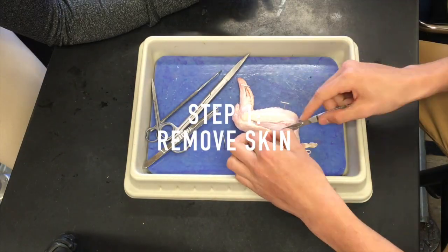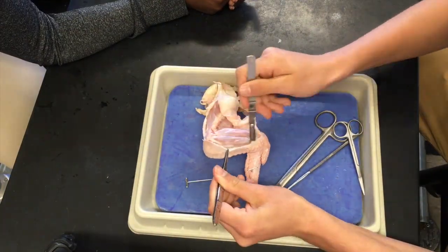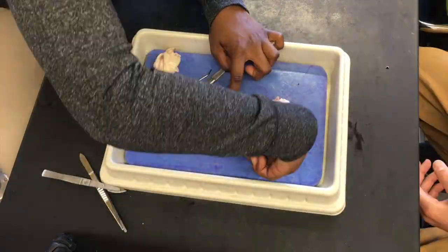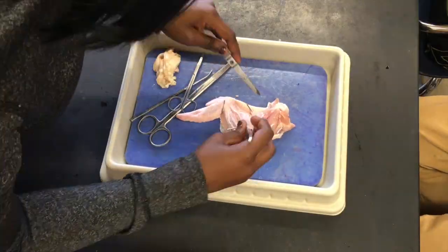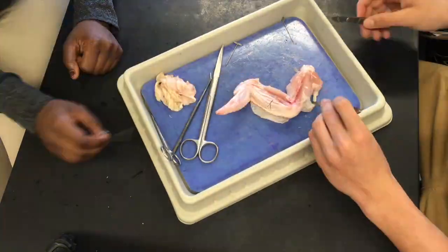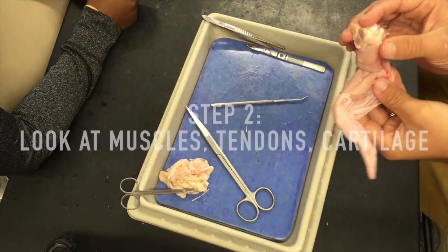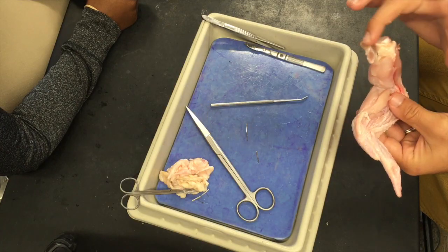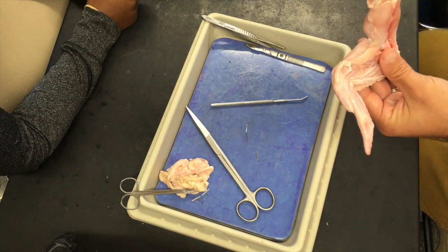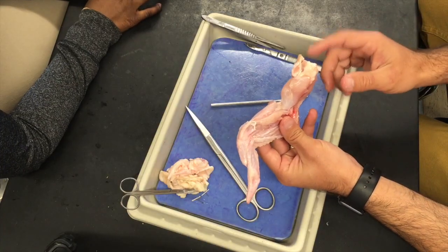We've got seven steps that we're going to follow. We can start off at the top. When they cut this piece, they cut through some of the cartilage, but this is all the cartilage in the shoulder joint. If you've felt your cartilage at your table, you've noticed it's really smooth. Why would you want really smooth cartilage? You want to have easy movement — you want your bones to be able to move very, very fluidly — so you want that to be smooth cartilage.